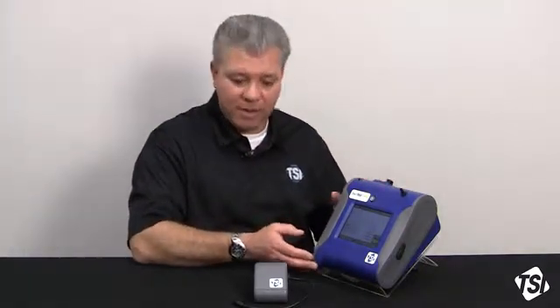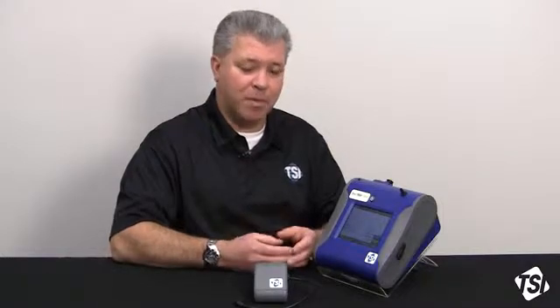Two of those that come to mind readily are indoor air quality monitoring, where you may be monitoring for 24 hours at a time, or fugitive emissions monitoring, a very common outdoor environmental monitoring application that the DustTrak is widely utilized for. Certainly in the environmental application for fugitive emissions monitoring, the DustTrak would be put into an environmental enclosure. For the purpose of this video, I'm not going to utilize an enclosure here, but I'm simply going to show you how to attach and set up the Auto Zero module for a sample run.